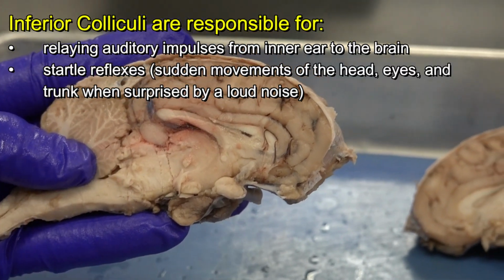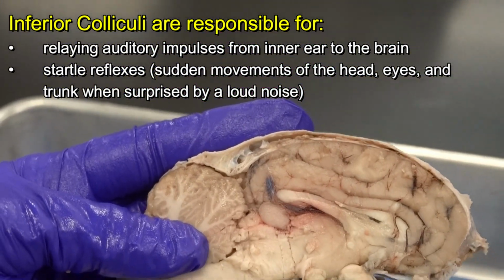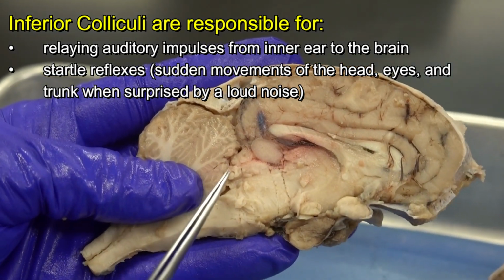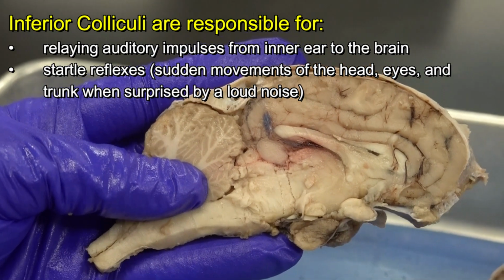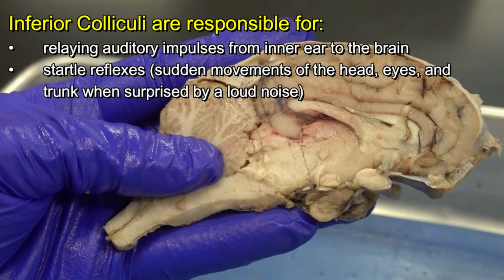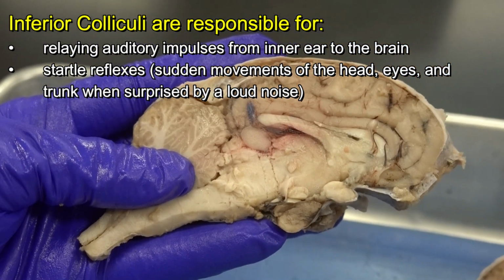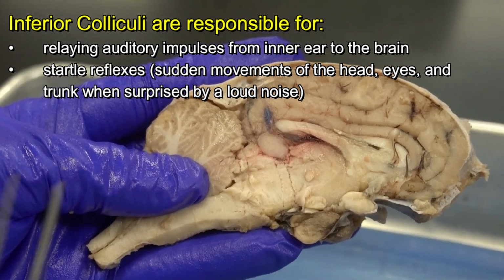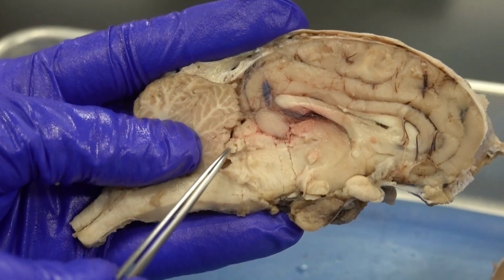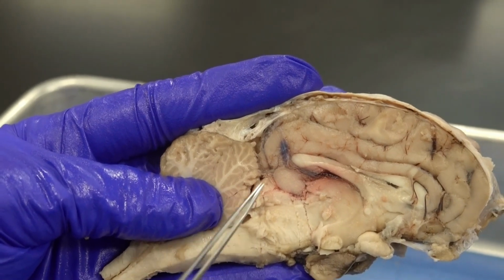The inferior colliculi are pathways for auditory impulses that from the inner ear we want to send to the brain. And also in the inferior colliculi, we have those neurons that are in charge of reflexes such as the startle reflex. When you hear an unexpected loud noise and suddenly you have a sudden movement in your head, trunk, and eyes. So that's the job of the inferior colliculi. And if you pay attention, you see that in sheep, the superior colliculus is much larger than the inferior colliculus.